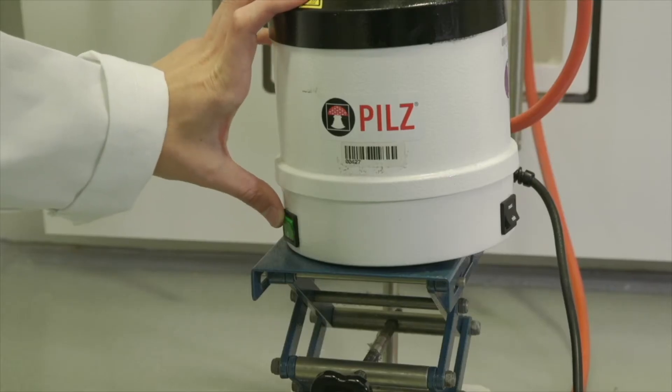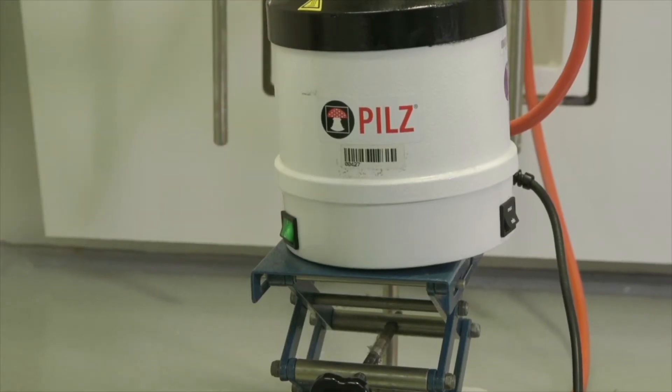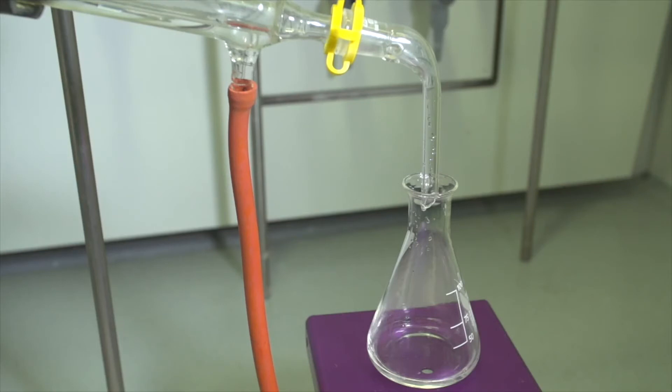The isomantle is turned on to stand 7 or 8 to start the distillation process. When your extraction is finished, turn off the isomantle and twist it to lower it away from the flask. This will help to cool the flask down much faster.